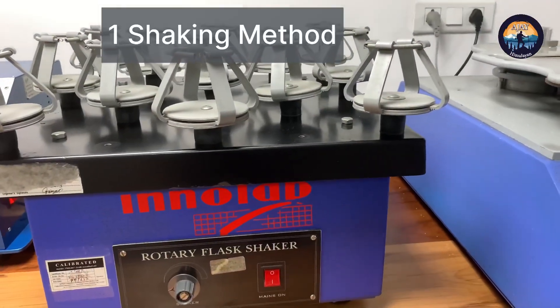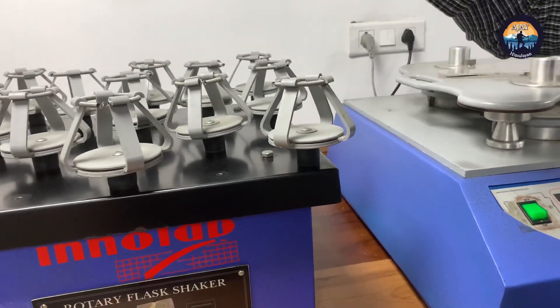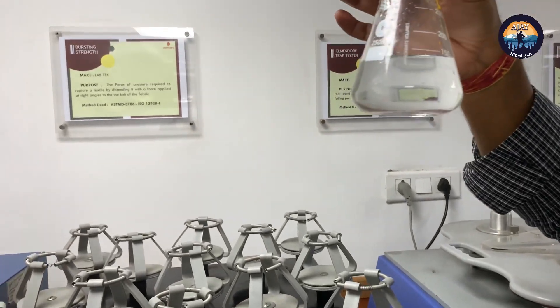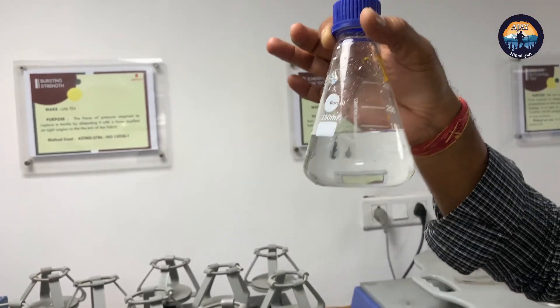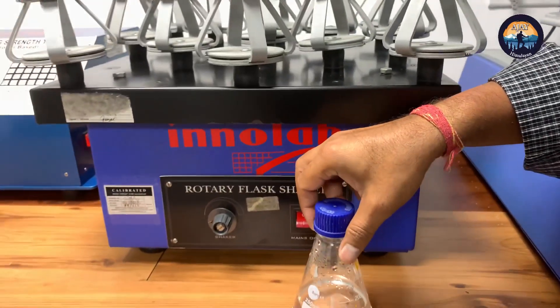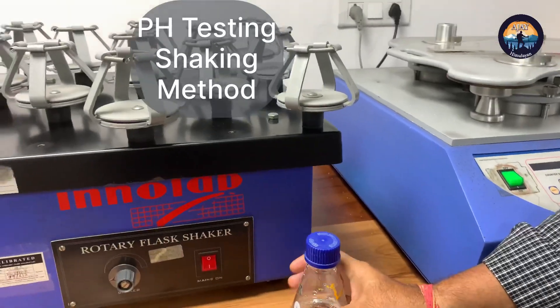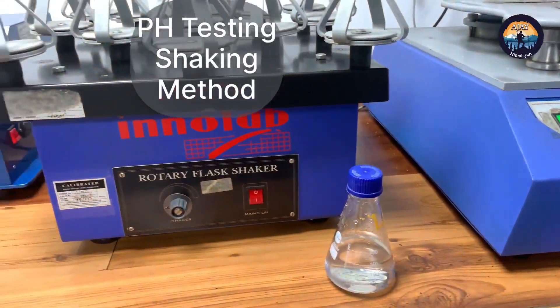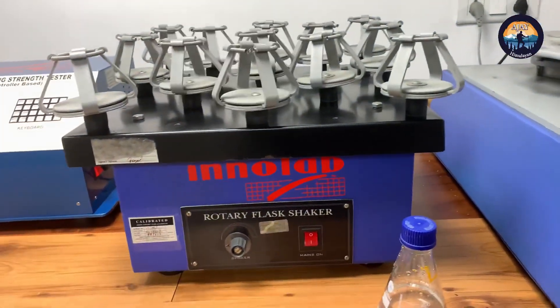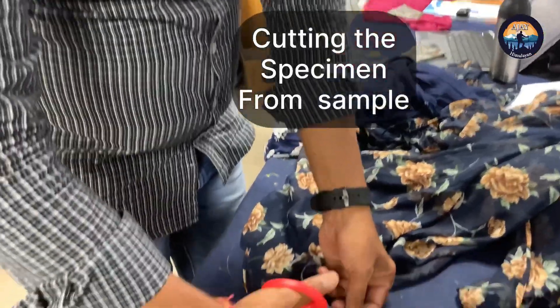This machine is for the shaking method. For the shaking method, we need 150 ml of distilled water to test the pH, and we need 2 grams of specimen taken from the production sample.